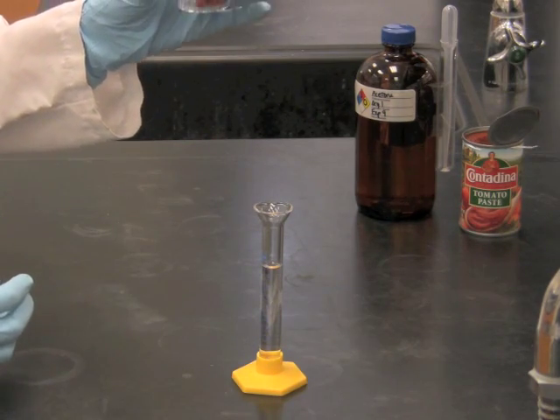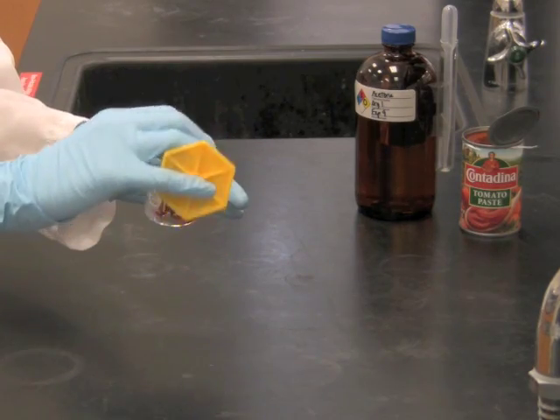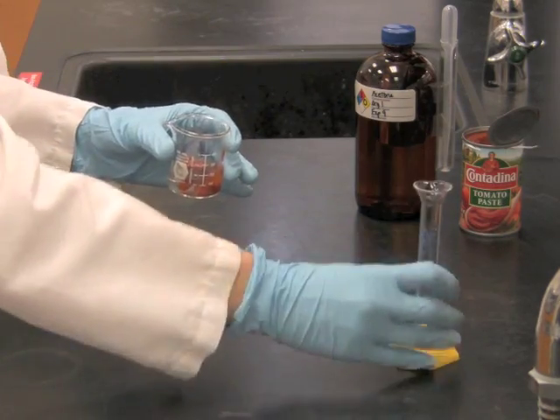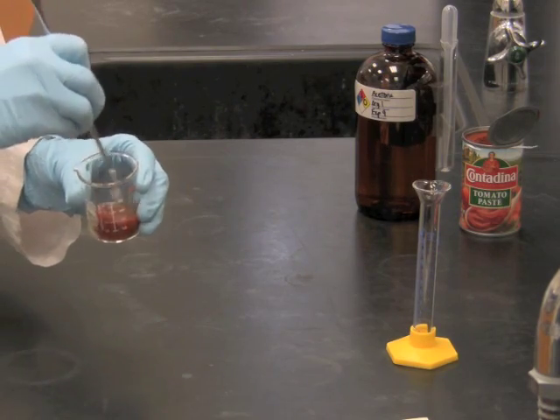Start with 8 grams of tomato paste and 10 milliliters of acetone. Mix them together and mix the tomato paste with the acetone for 3-4 minutes.